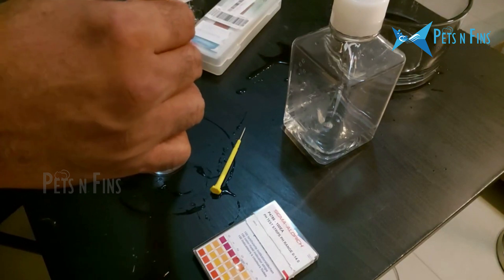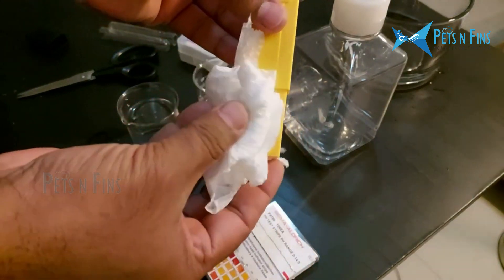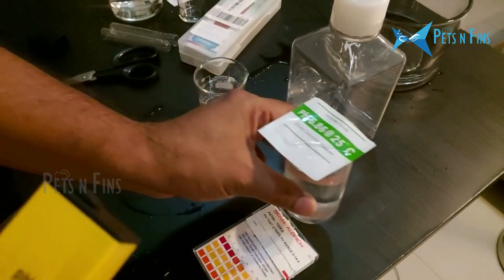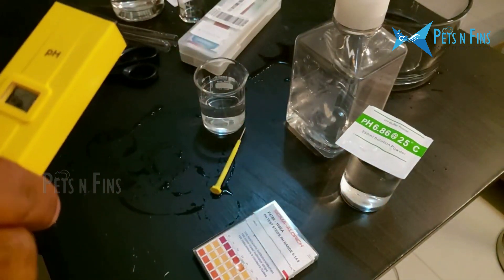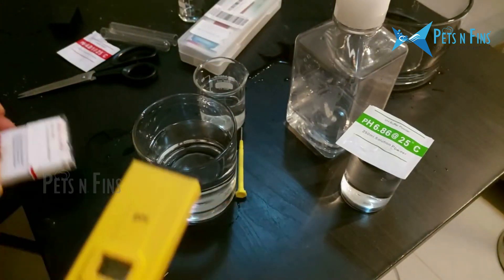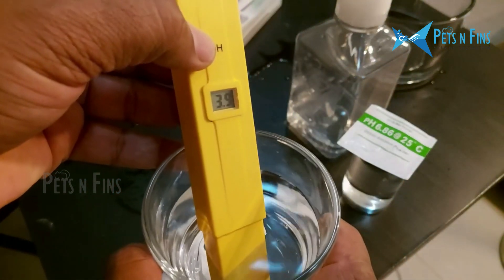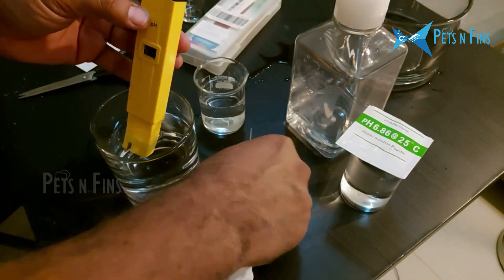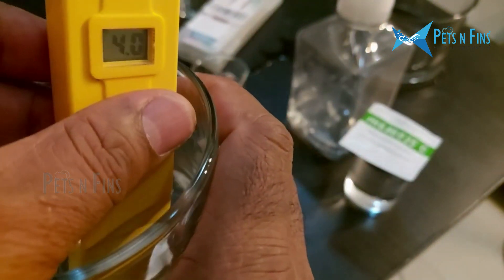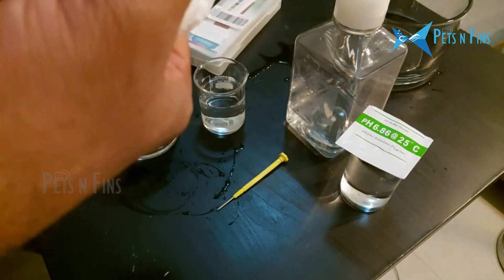We are going to wash and dry the probe and the beaker. We add the second buffer solution. If we add it, the reading goes to 3.9, then 4.1. Now we have 4.01 on the meter. Now we have 4.01 and we finish this calibration step.